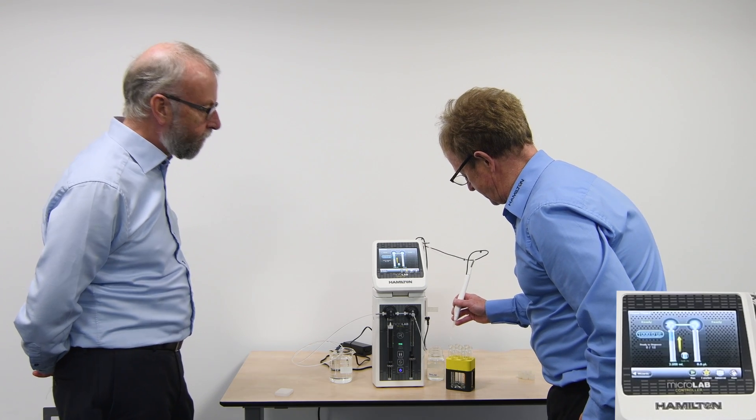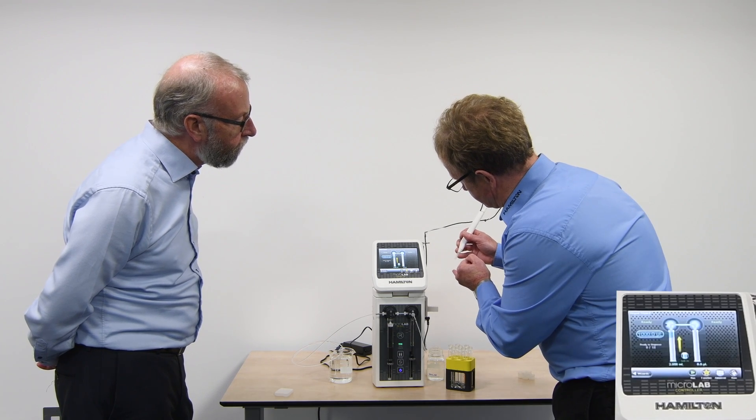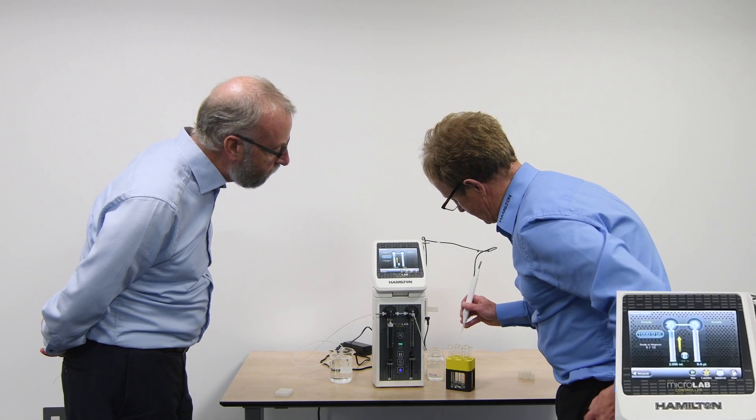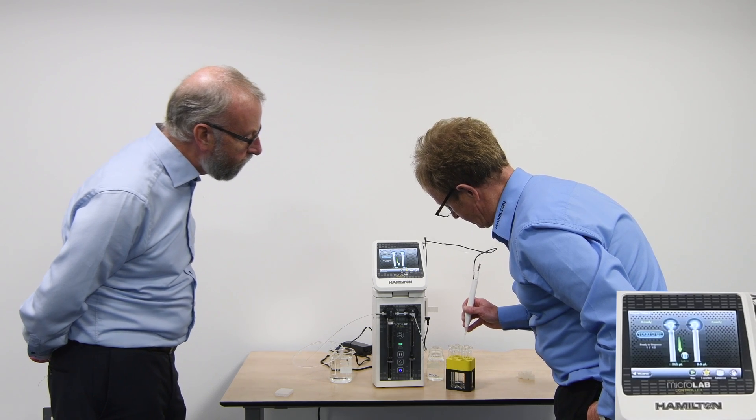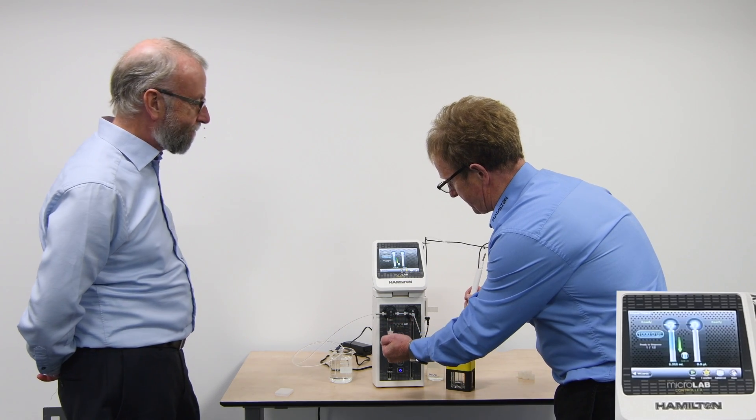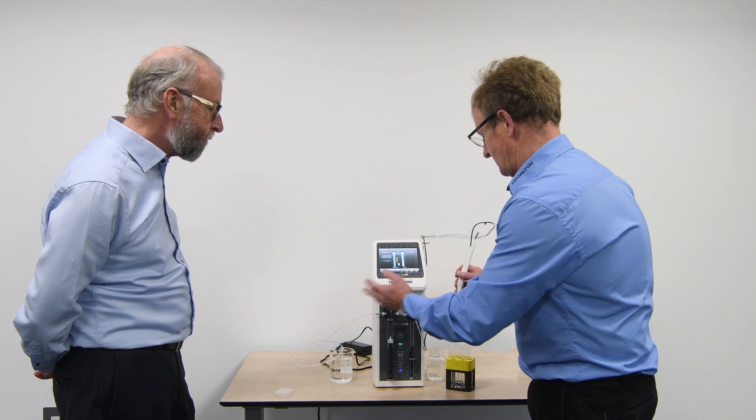Exactly, yes. We can choose, as we've seen here, we're going through, because this is positive displacement, so it has a positive cutoff, and you can see the small air bubble there. We're moving through, dispensing that 1 ml each time, and then it'll automatically refill to the end of that program. Yeah, good. Done we'll run through.